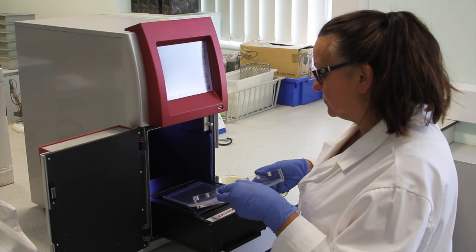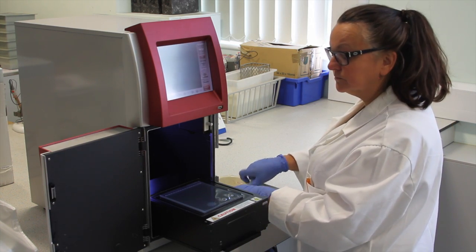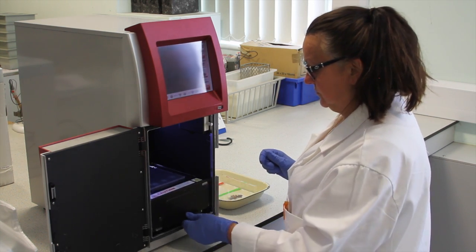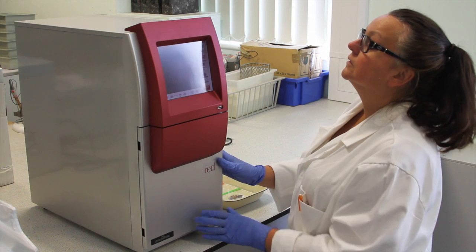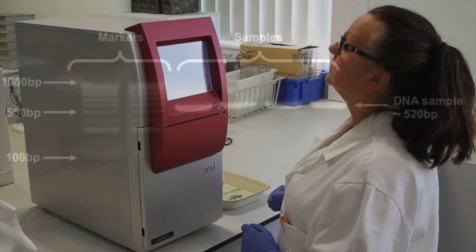You should now take the gel to the imaging system. Carefully slide the gel onto the plate. Push in the drawer and close the door. Press UV on the display. This will then show an image of your gel.